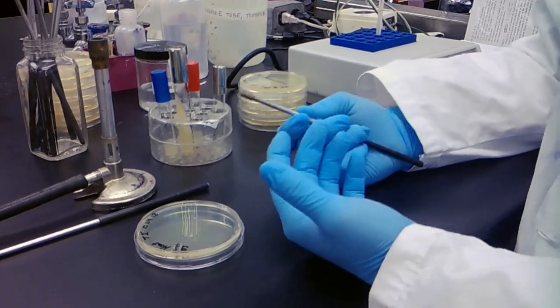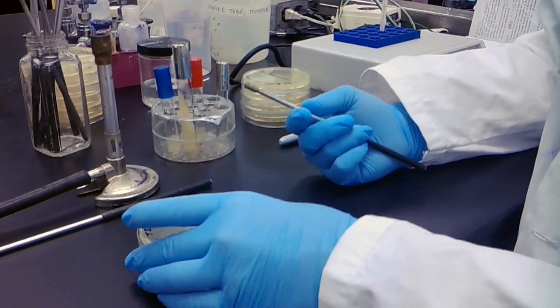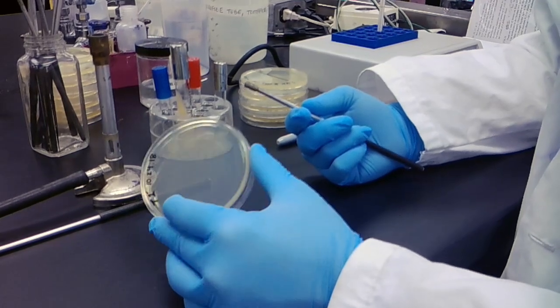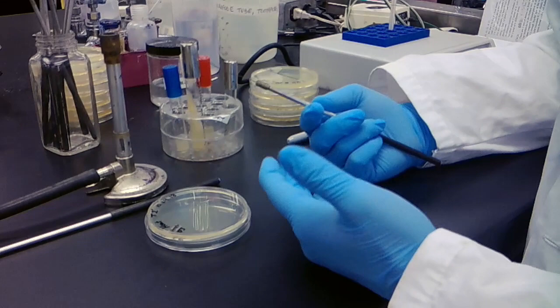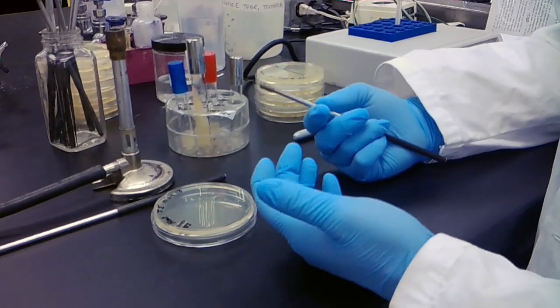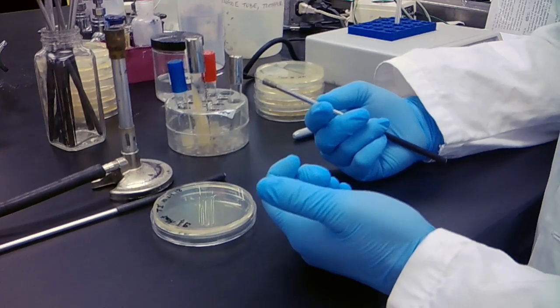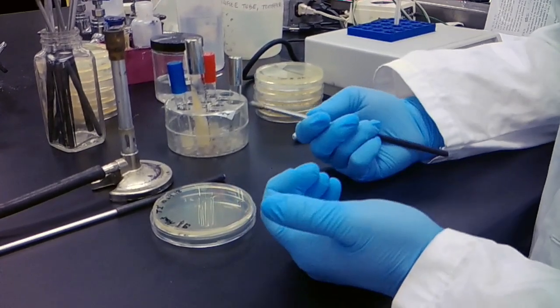Like I said, we're going to be repeating this for each plate. I'll just show the spreading to isolation for these first two plates and you should get the concept of what we're doing for the five minute and 30 minute time points, since they're the same thing, just a different time point.